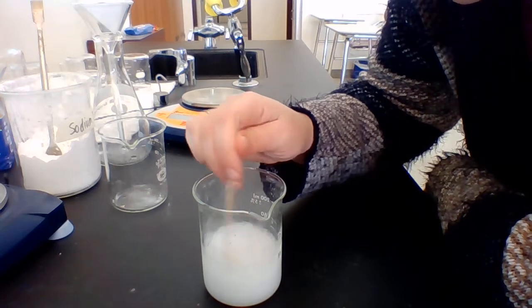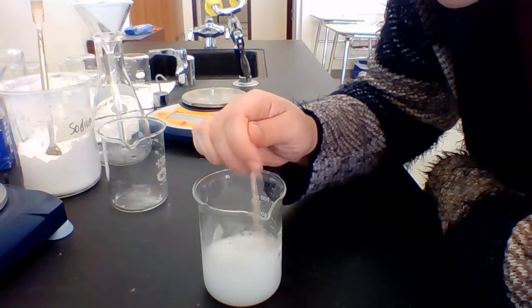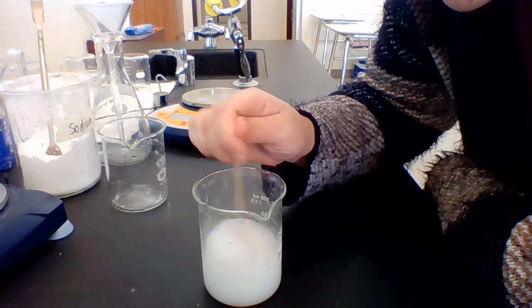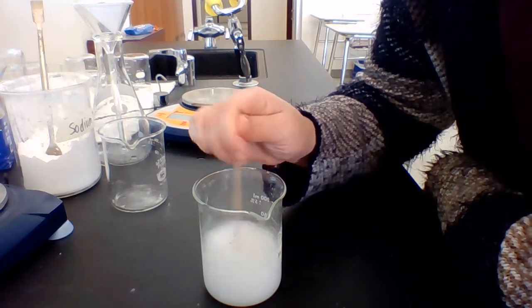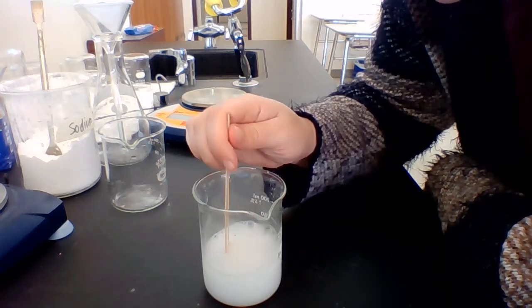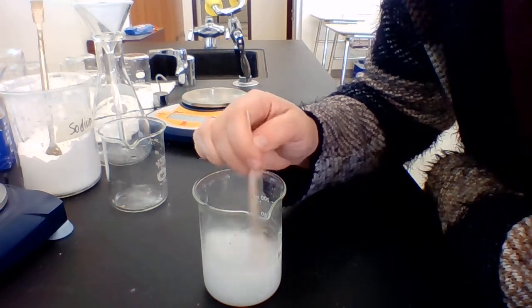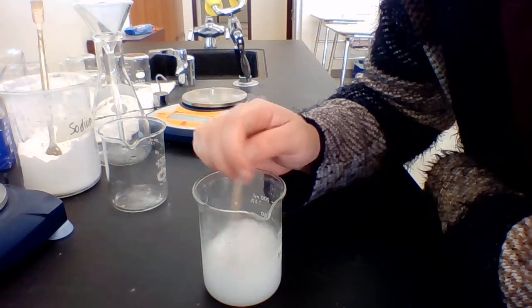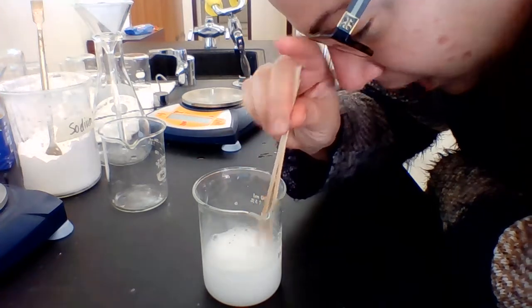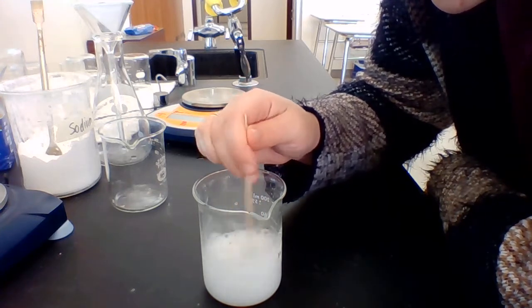Now I'm going to stir this a little bit longer because I want it to keep reacting. I want the reaction to finish because I want it to keep forming more of these particles. So let me just stir it a few more times. And then we're going to collect the product of this, which is calcium carbonate. That's what we formed. And we're going to collect it in this filter paper. After we collect it, we're going to leave it to dry over break. And we can then measure it.